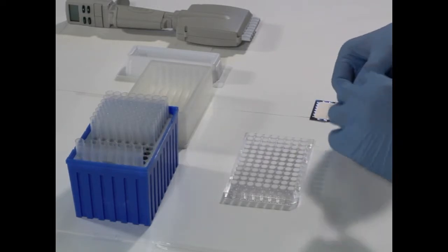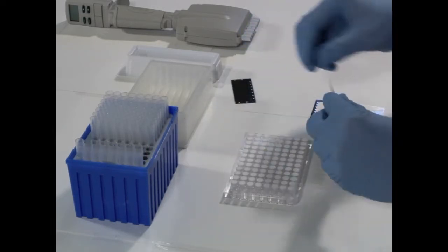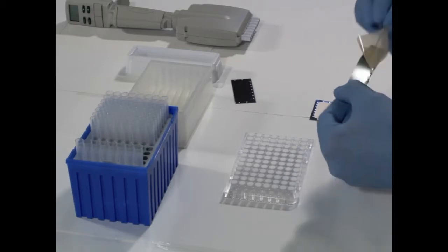After hydration, the hydration solution is removed from the top plate and the plate is turned upside down.